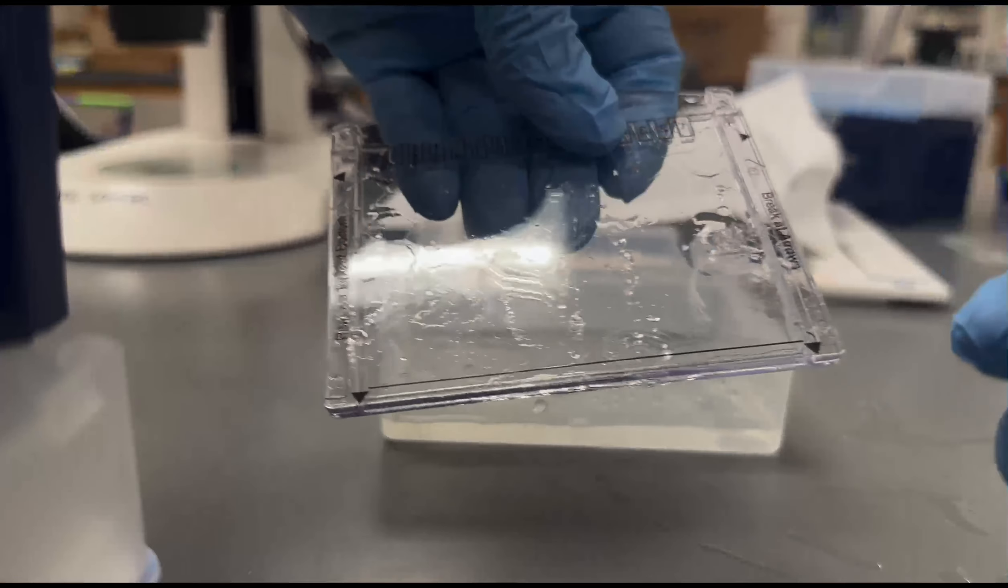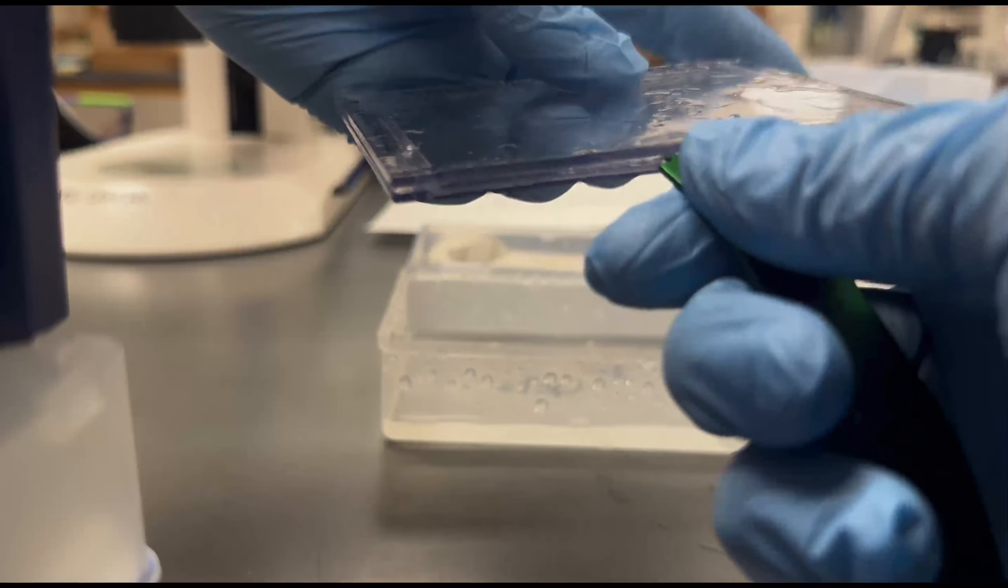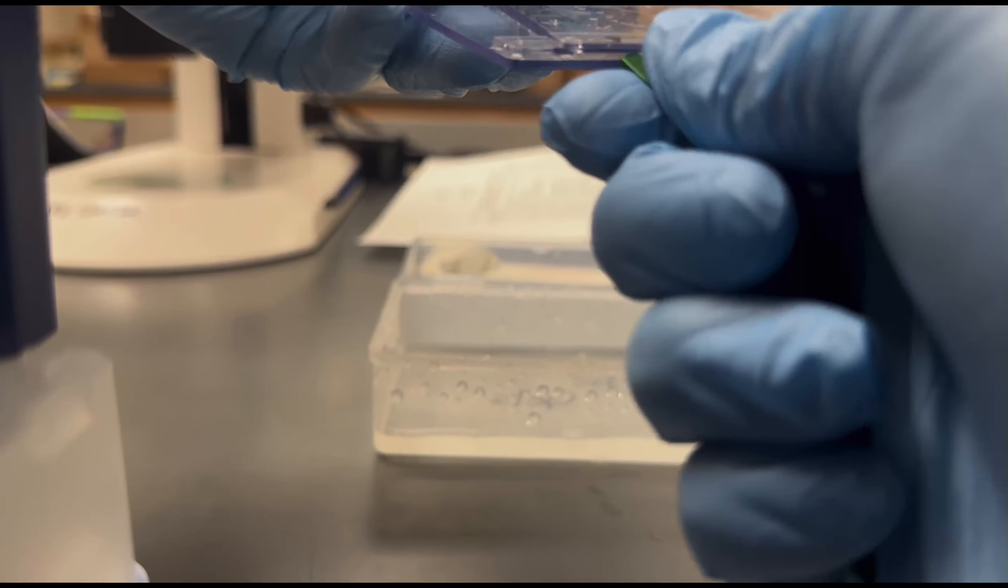Once complete, the gel is then removed by cracking open the plate and placed into DI water for a quick rinse.